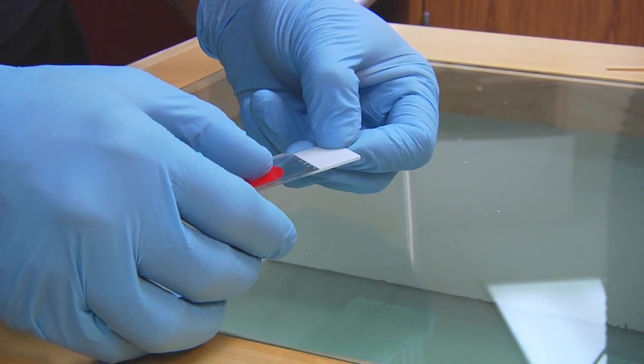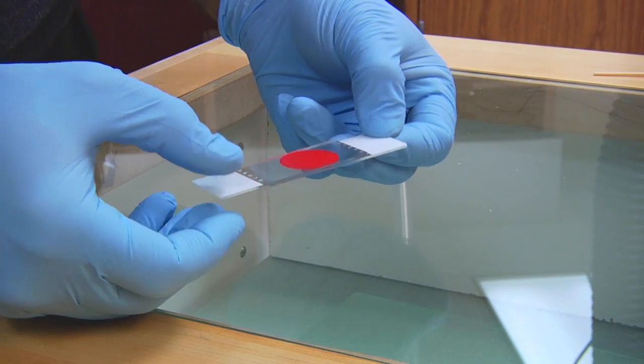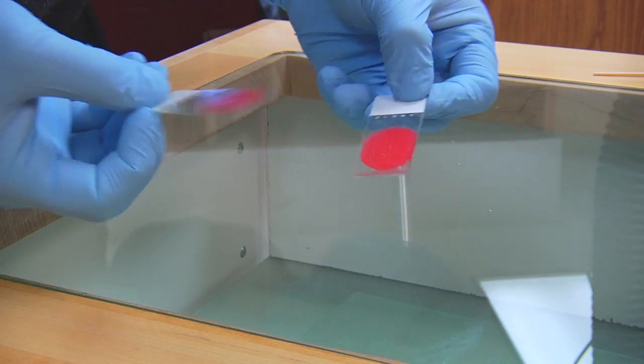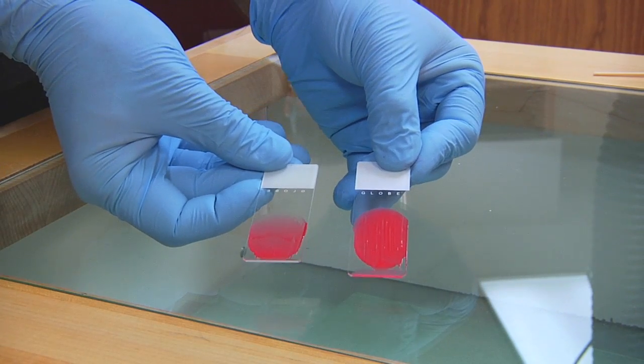Gentle pressure is applied to the material to spread it and then the slides are pulled apart to make mirror images of the material as you can see on these two slides.